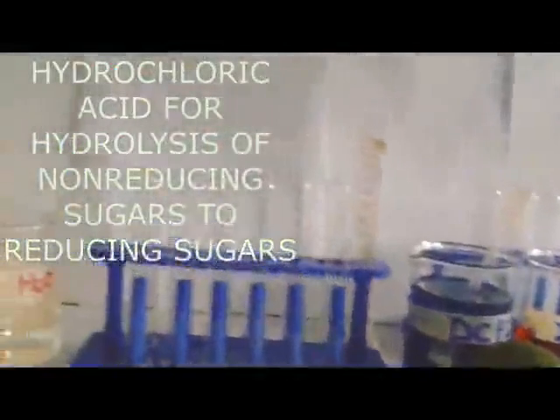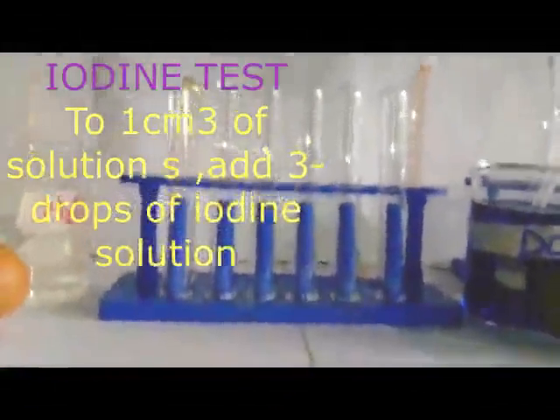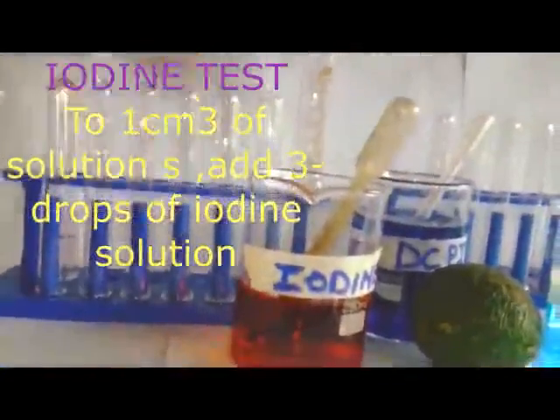Now, at the start, we are going to look at the starch test. For the starch test, we are going to consider our reagent, iodine. That is the one we are going to consider as our main reagent.